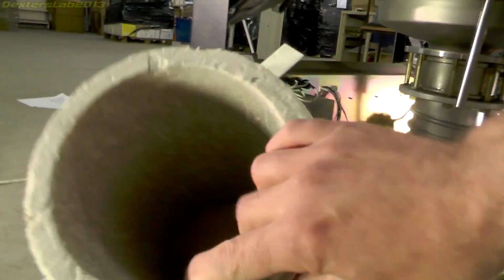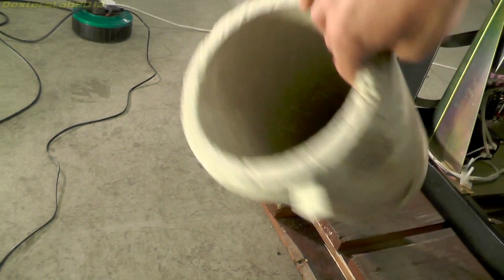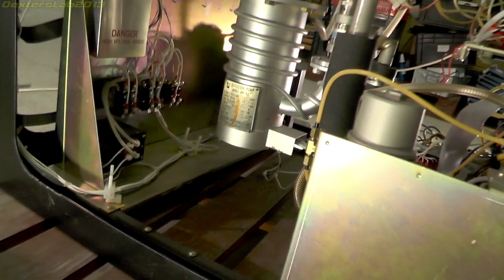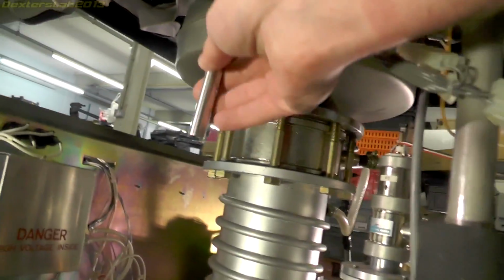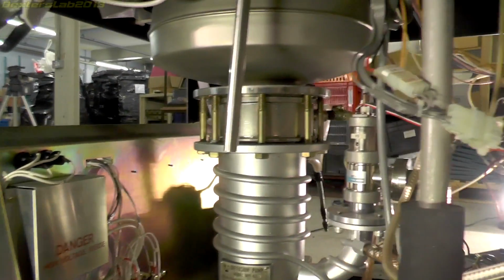We have this bit of polystyrene, some kind of container for something, I'm not entirely sure, maybe something to do with liquid nitrogen. This pipe sort of pointed into it, but it's not securely attached to anything, so I'm not sure what that was for.